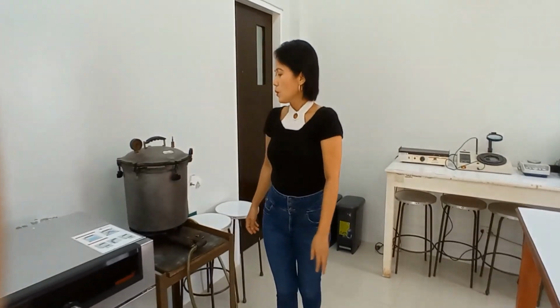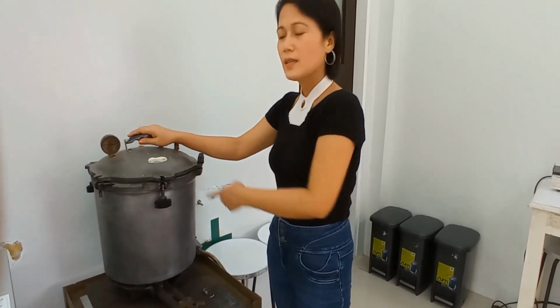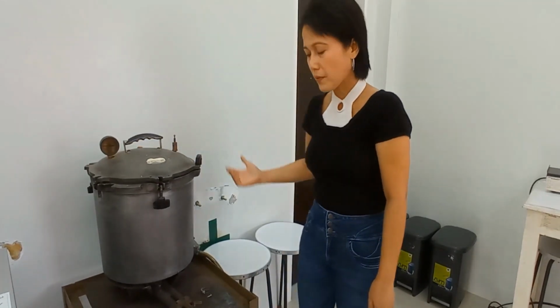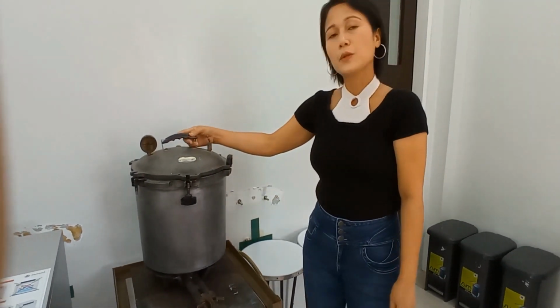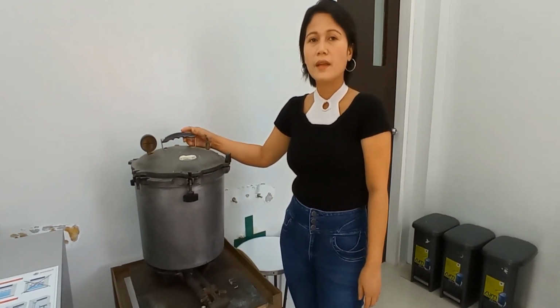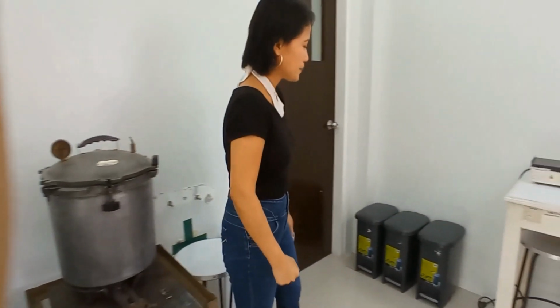And next, we have in here an autoclave. Now, my students before in Mindanao State University, do you still remember this? Oh, this is quite an old type of autoclave. We are using this connected to gas. This is still very, very useful because blackouts are still very real here in our area. So when there is no electricity, when there is no power source, we are using this to sterilize so our experiments can still proceed.